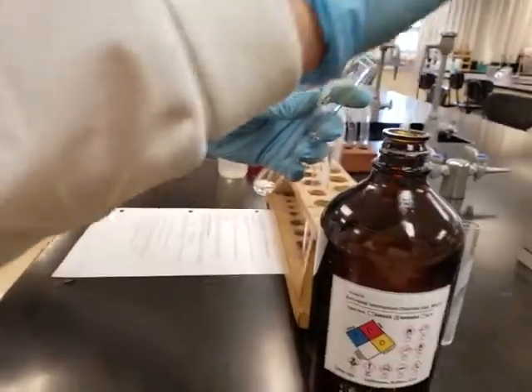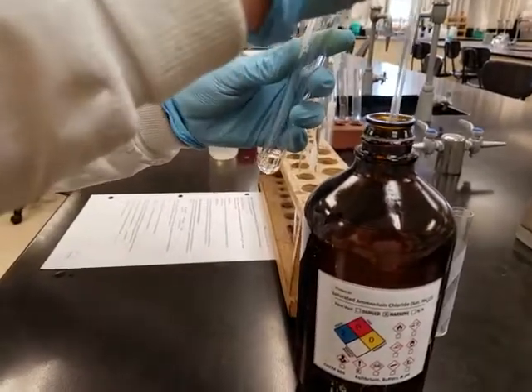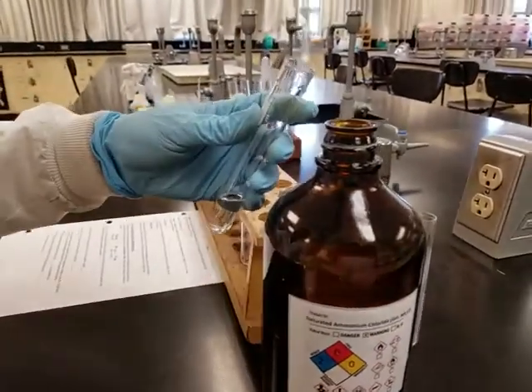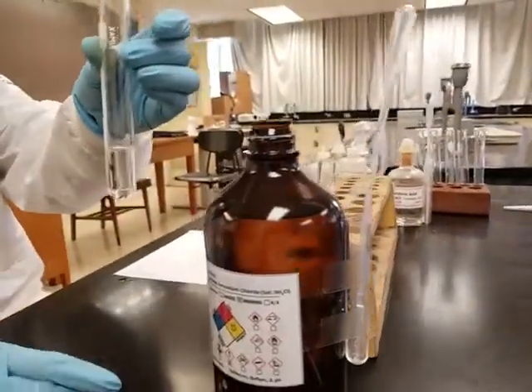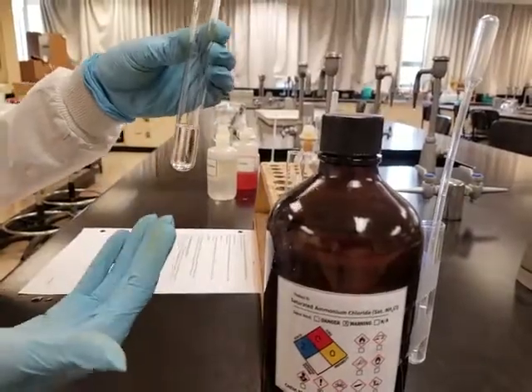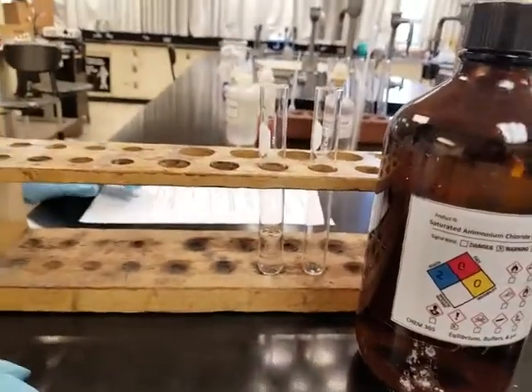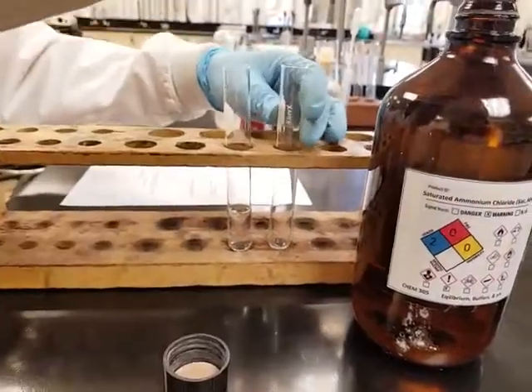So we're going to fill in only the solution part of the saturated ammonium chloride. Okay, again, this is part A. So here it is. I think this is enough. This is what ammonium chloride looks like. There's not much of a color, but here it is. Let's switch this around. Is this better? Yeah. All right.